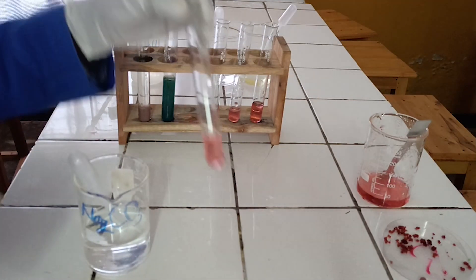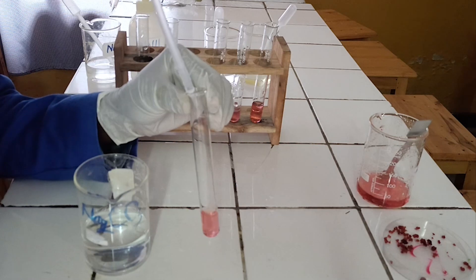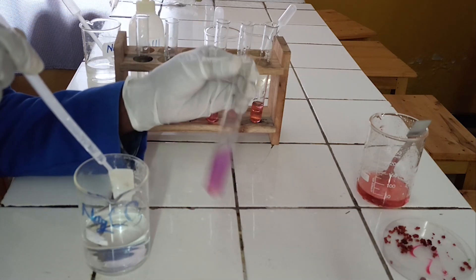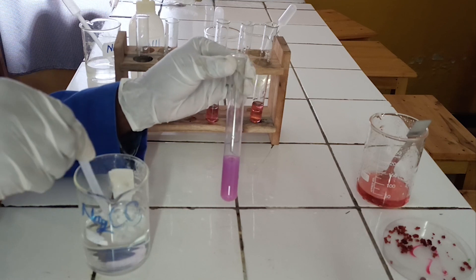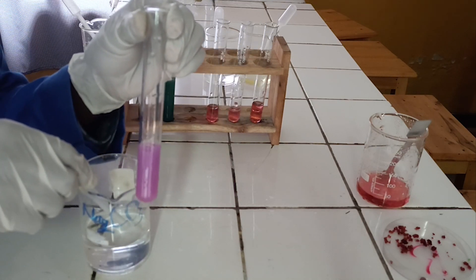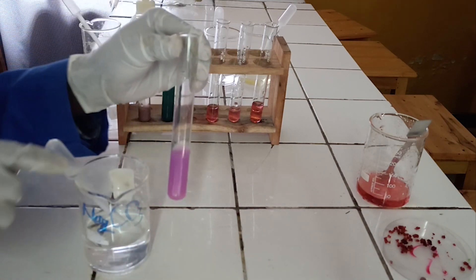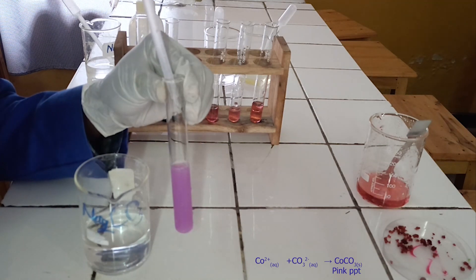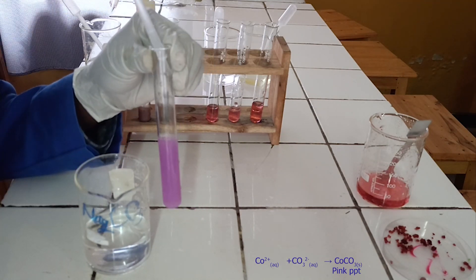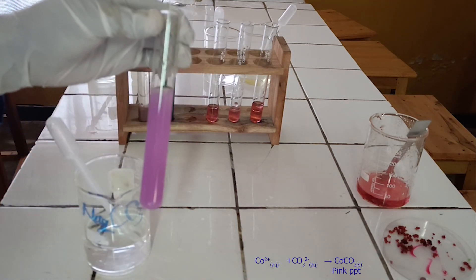To the third test tube, add sodium carbonate solution dropwise until in excess. As you see, sodium carbonate reacts with cobalt-2 ion to form a pink precipitate. This pink precipitate is insoluble in excess of sodium carbonate. Below there is the ionic equation for this reaction.